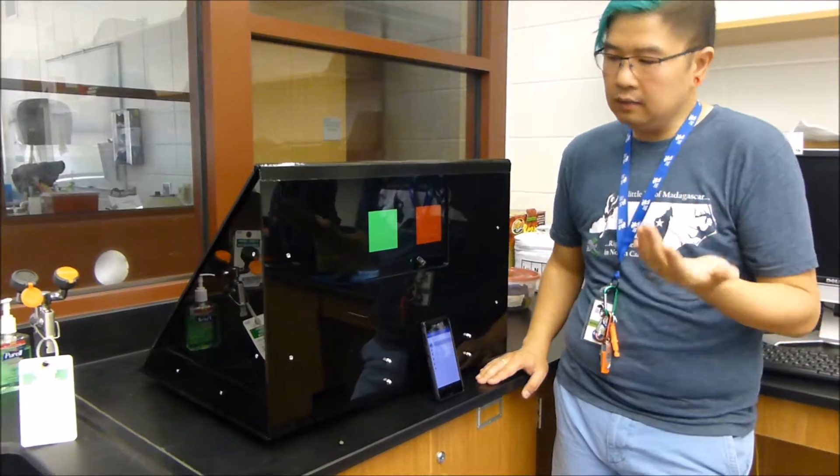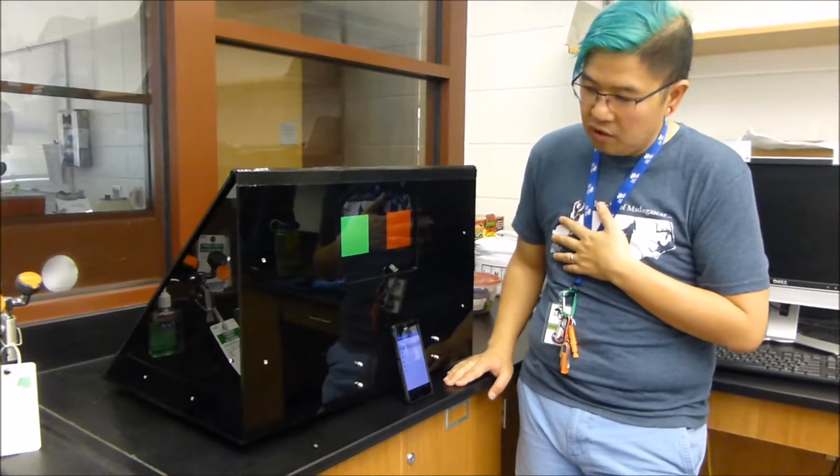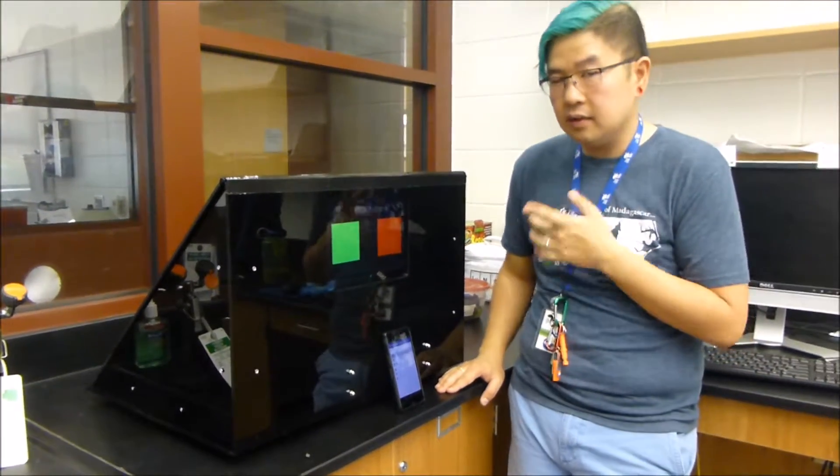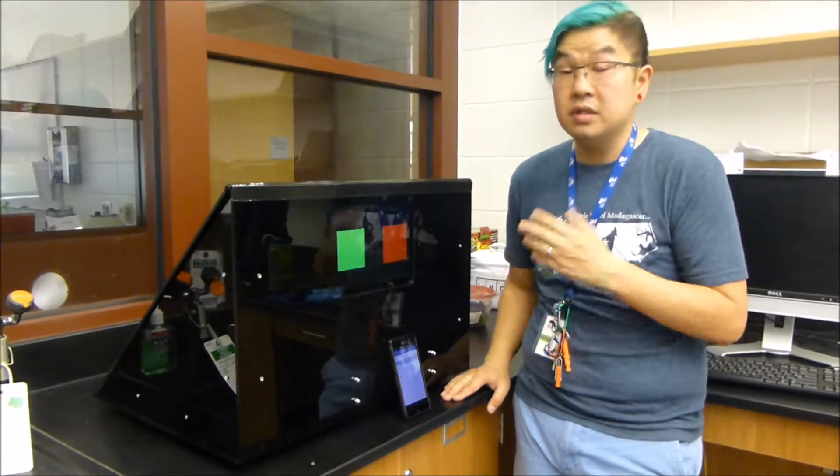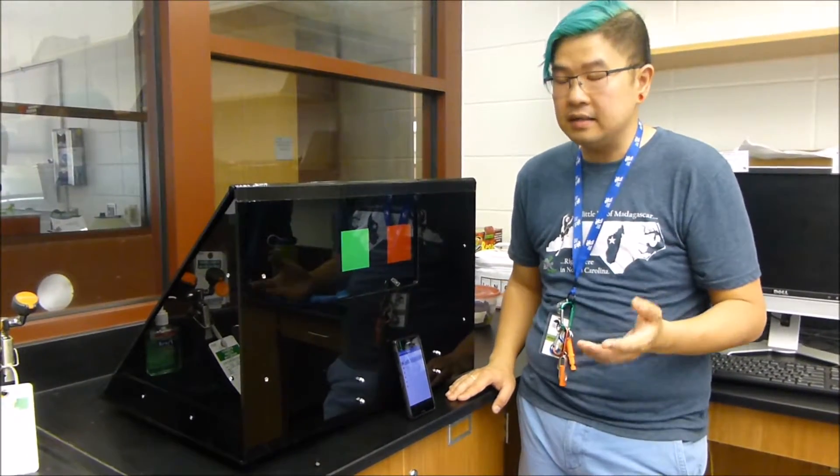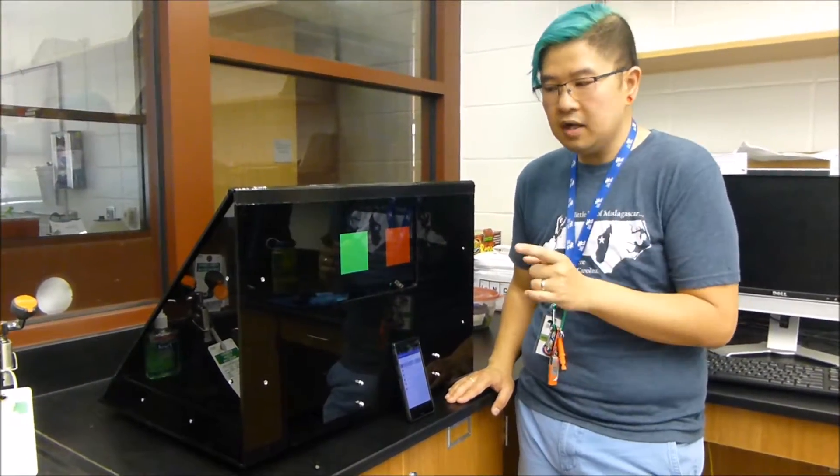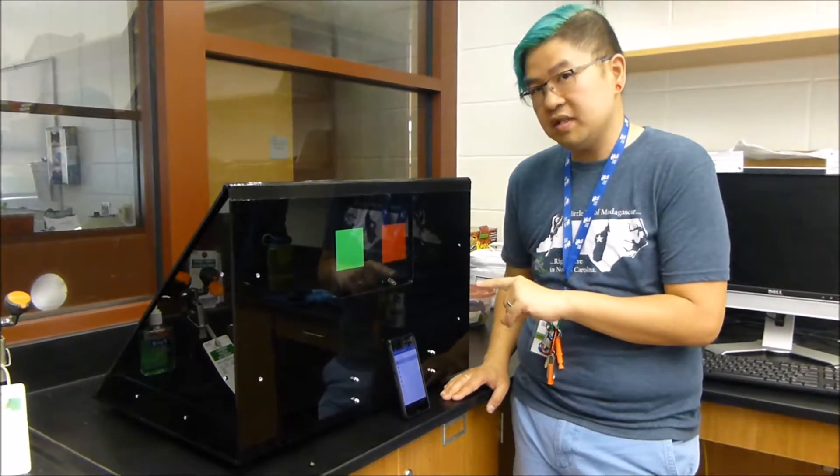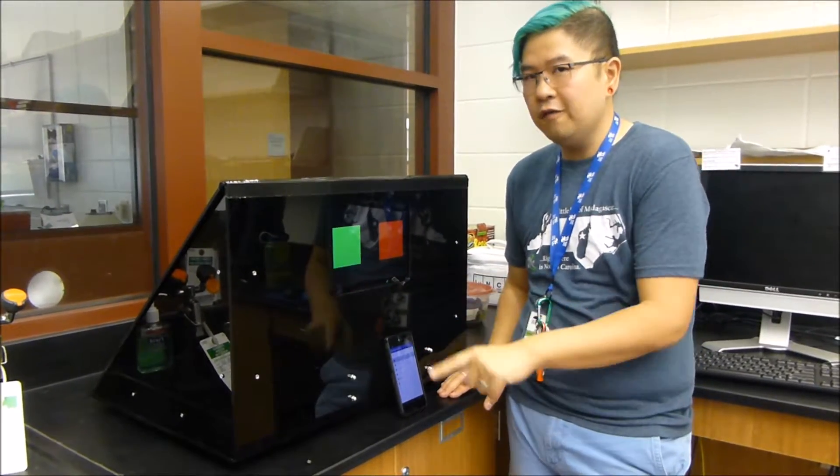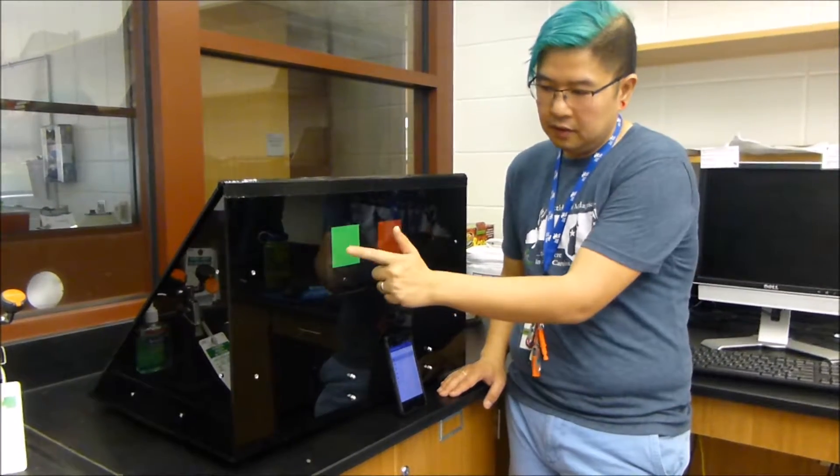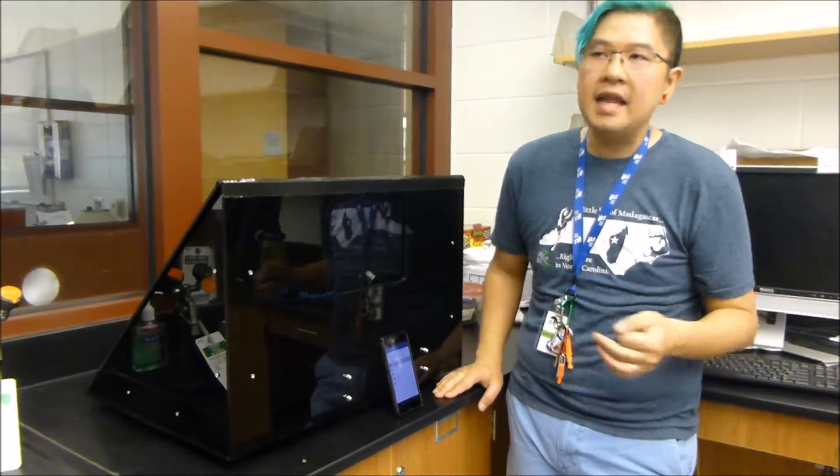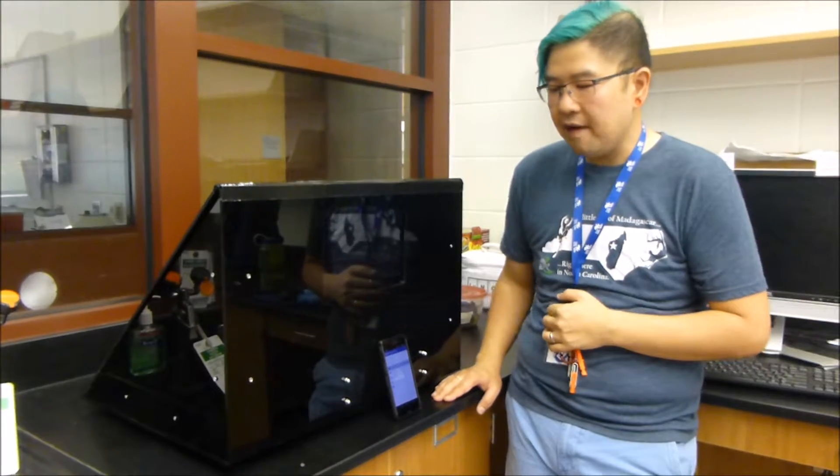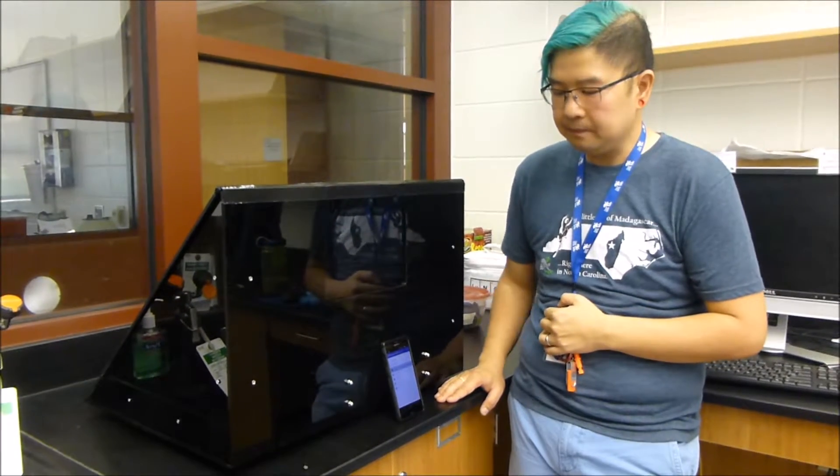Now, let's say I'm going to choose the green square, which is the incorrect choice. If you touch it, there will be no whistle and no food reward. Again, it waits five seconds.